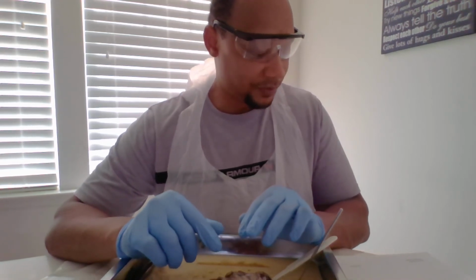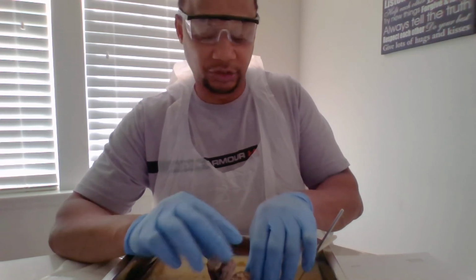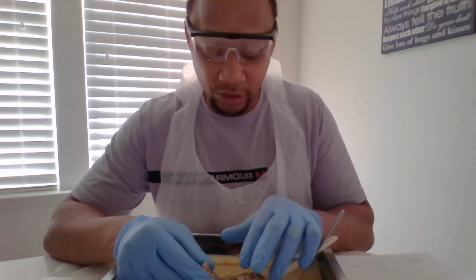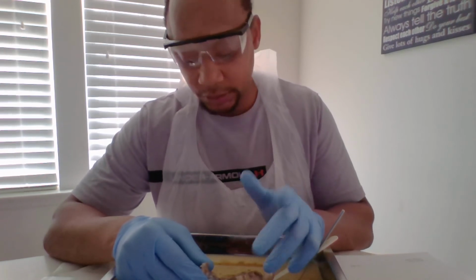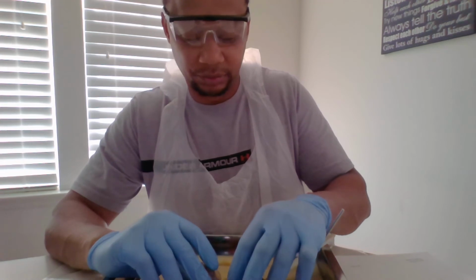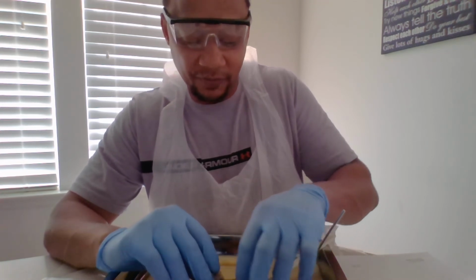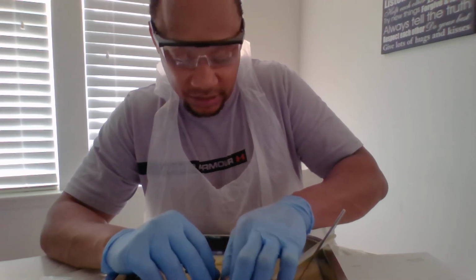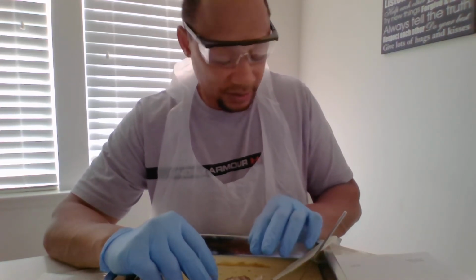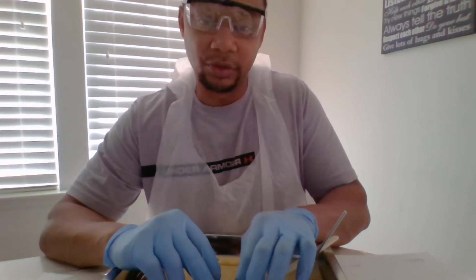Then you also have your other nerves. If I pull it up, that's the best way for me to identify them. CN III, oculomotor, is right below II in this area, and then you have IV right below that, and then V is in these grooves right here, deep down in here. Then you have VI, which are right below the pons.